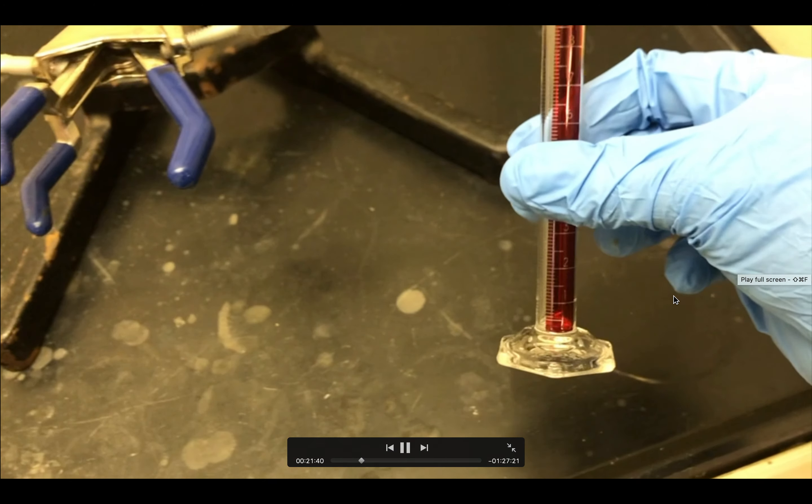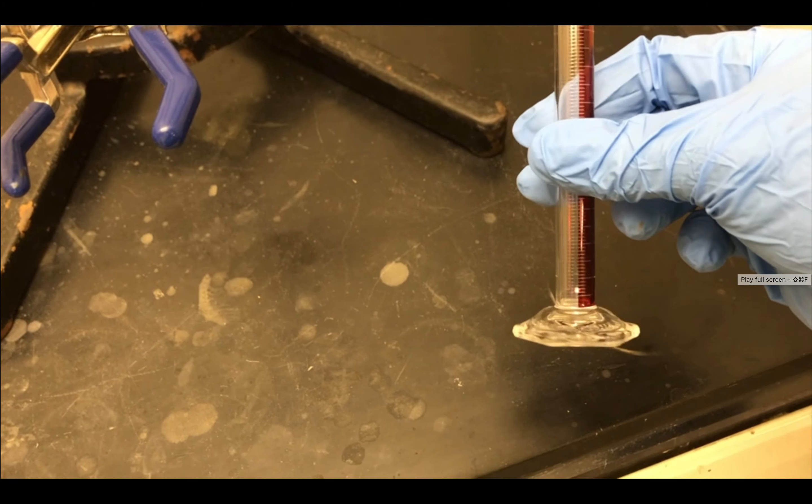And I have my Erlenmeyer, I mean, my graduated cylinder. I keep calling it Erlenmeyer today.